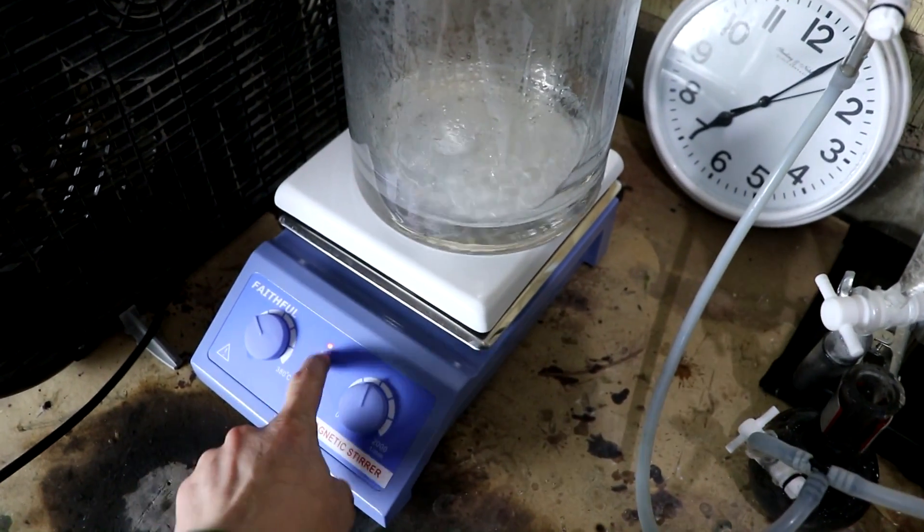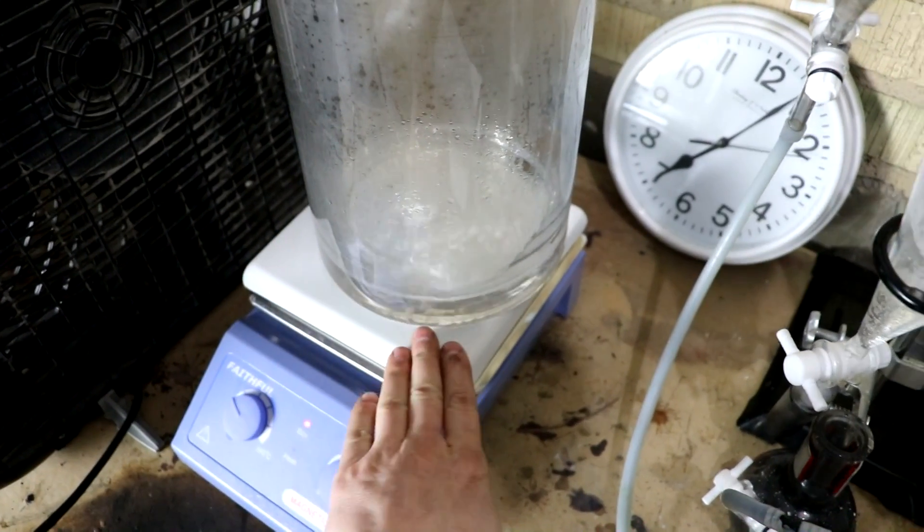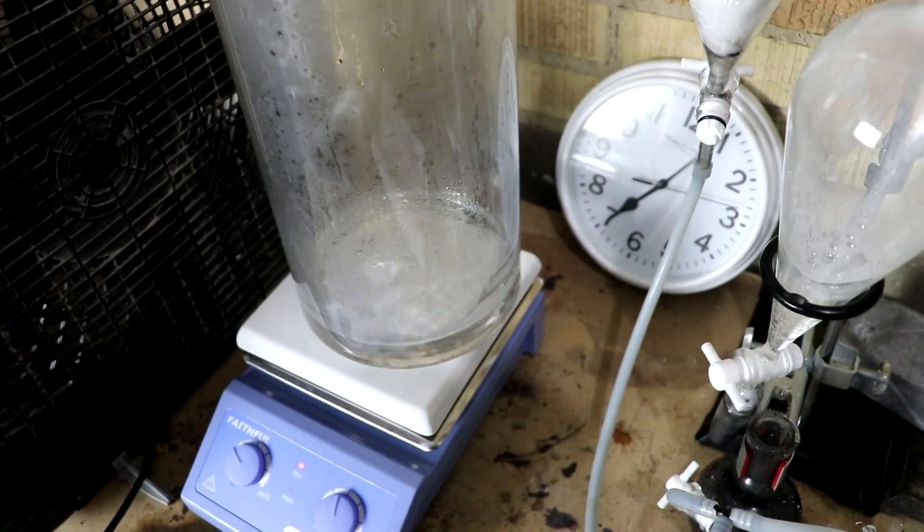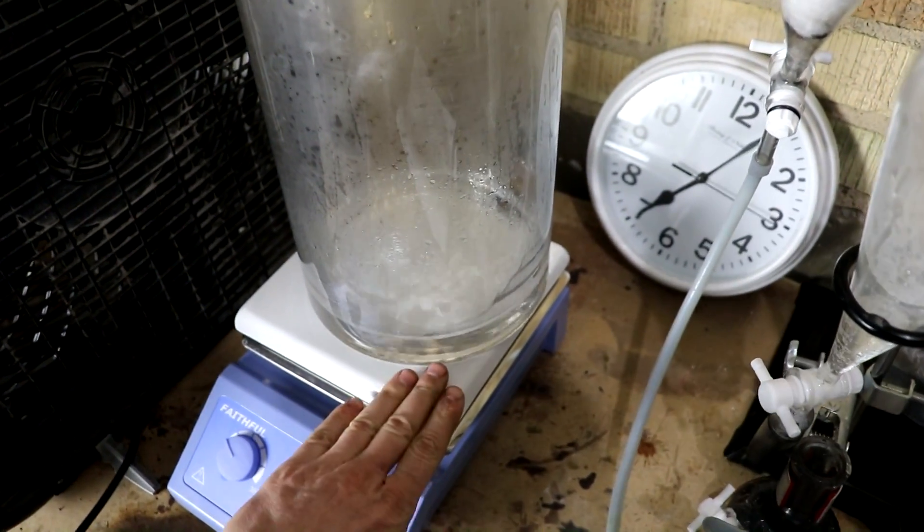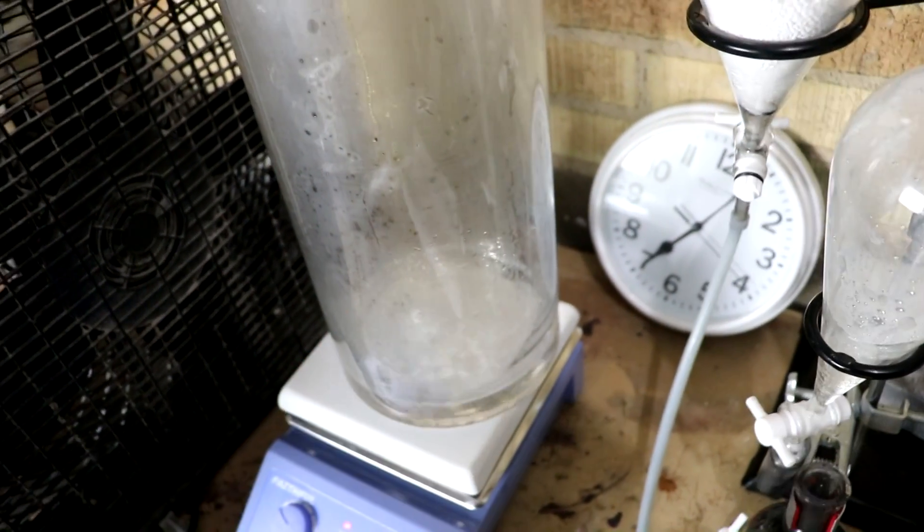Another update is I have turned on this hot plate. You know, just very low. It is near freezing in here, so I figure a little bit of heating probably wouldn't hurt. As long as I can hold my hand on there, it's probably not too hot. Just don't want to break the glass.